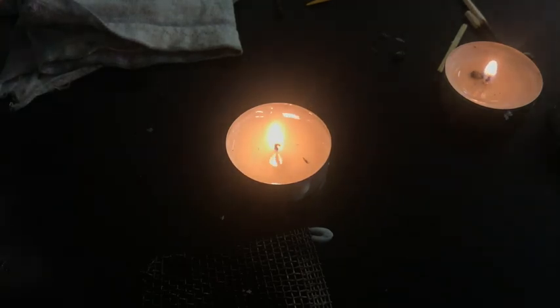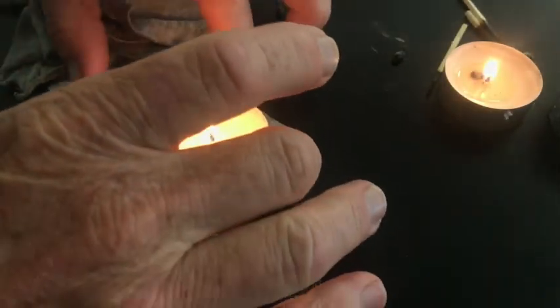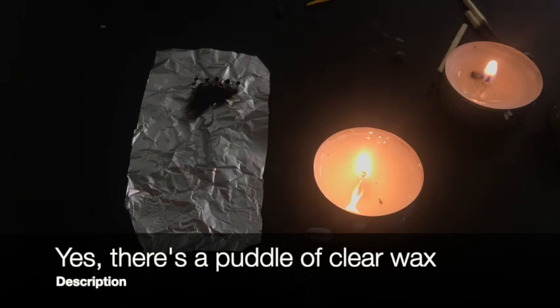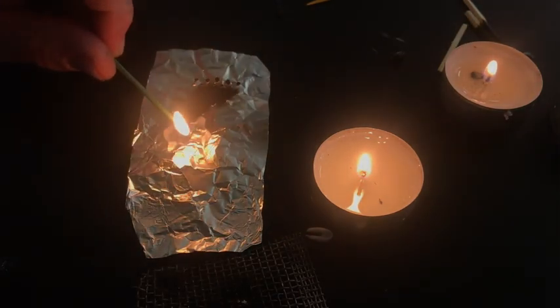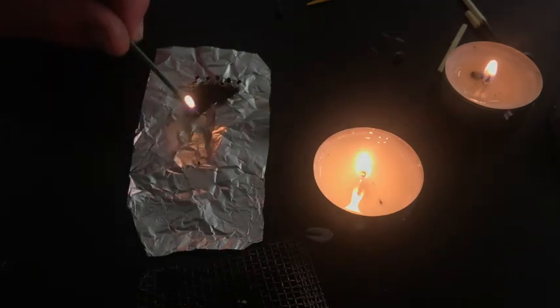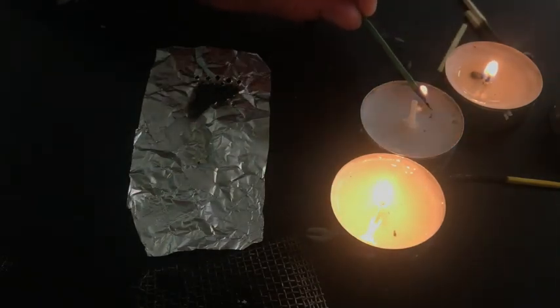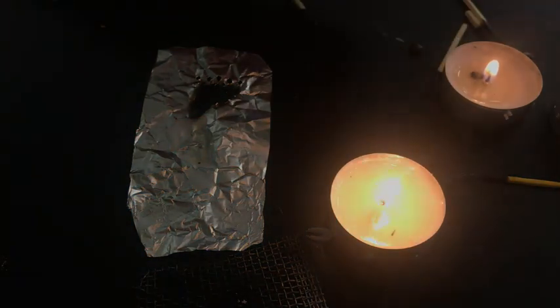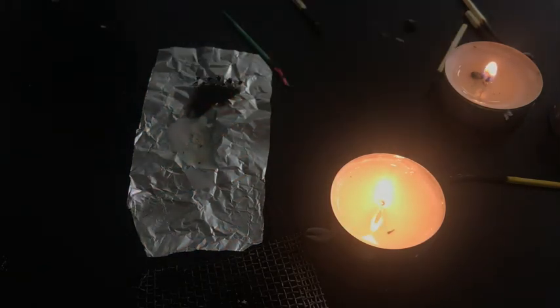Okay. So what that's an indication of is the fact that if I take liquid wax, here's my liquid, and I try to catch it on fire. So now I'm just going to try to catch the liquid on fire, right? Nothing. No fire for the liquid, right? And certainly there's no fire for the solid. Here's solid wax. All that solid wax does is melt, right? So something's happening to allow that to happen, right? That change, that lightning strike of flame to go down there.